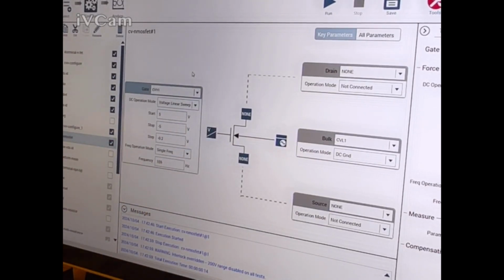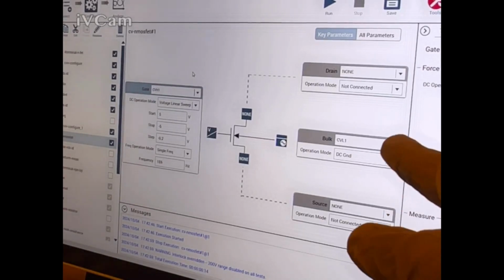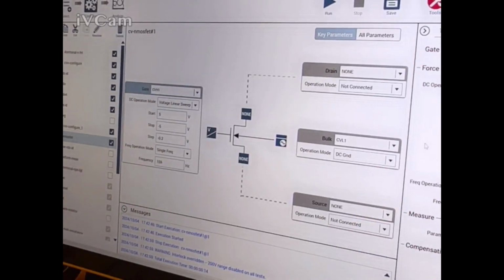You're missing the CV low, aren't you? You have one CV low and you have two none. Oh yeah, that's not right. You need a CV low. Oh, it doesn't matter because it's shorted up there. So it still doesn't matter. The problem is I'm connected to the bulk and I don't have a cable for the bulk. Okay, so let's just move this cable. Let's see if that works.